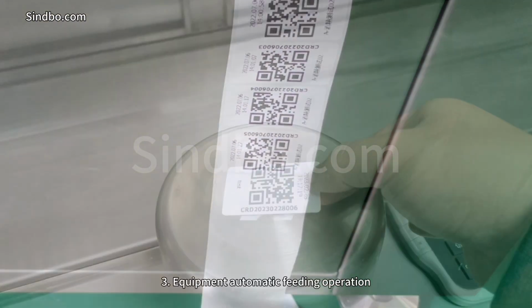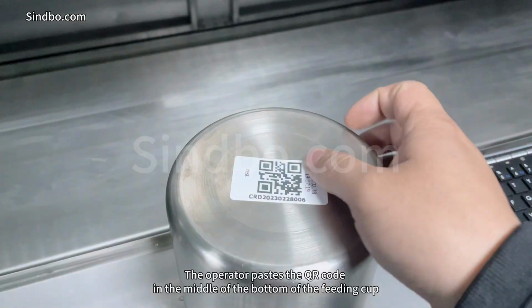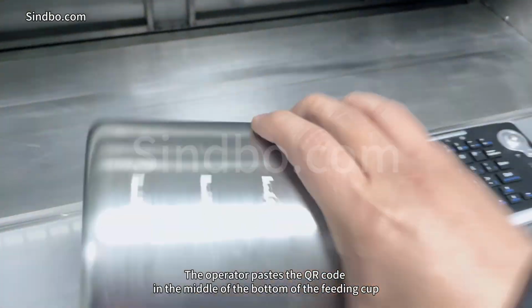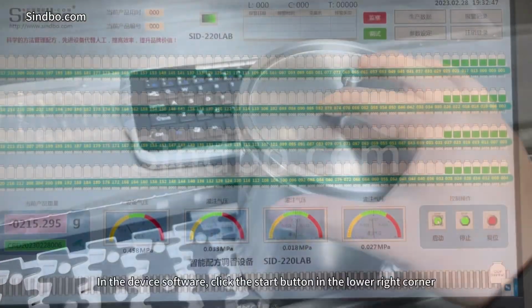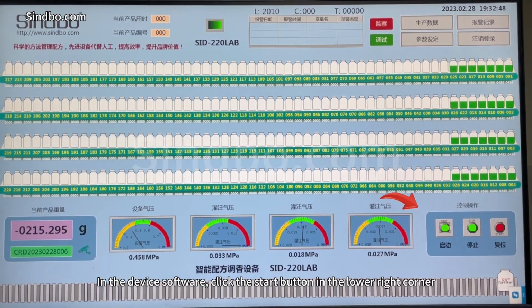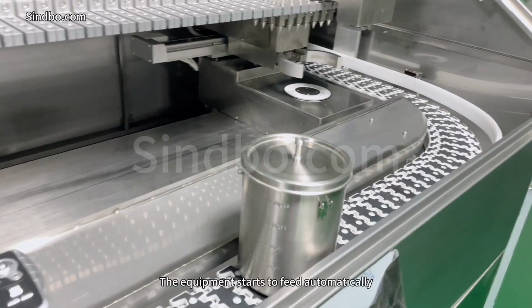3. Equipment automatic feeding operation. The operator pastes the QR code in the middle of the bottom of the feeding cup, then closes the lid of the feeding cup. In the device software, click the Start button in the lower right corner. The equipment starts to feed automatically.